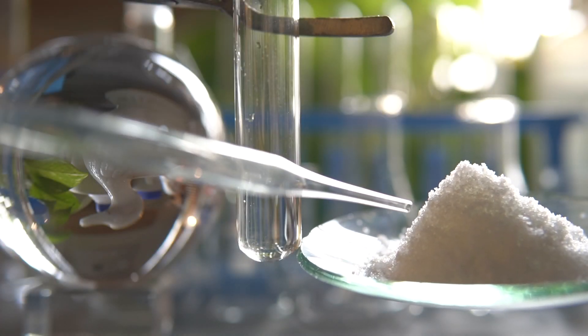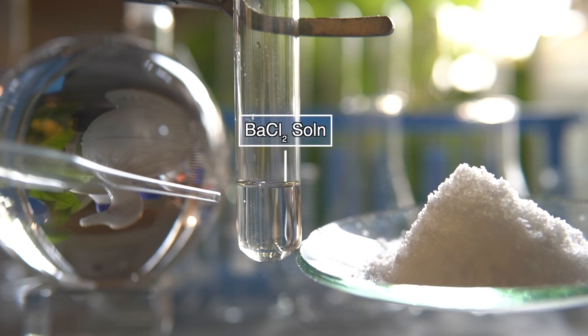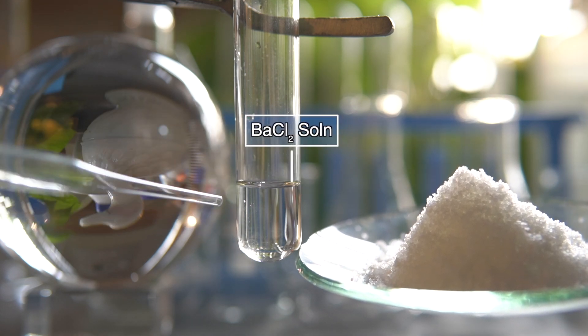To initiate the reaction, we will take some amount of barium chloride into this test tube.